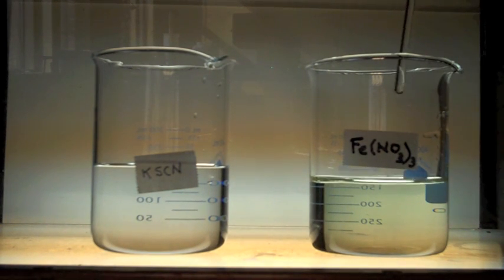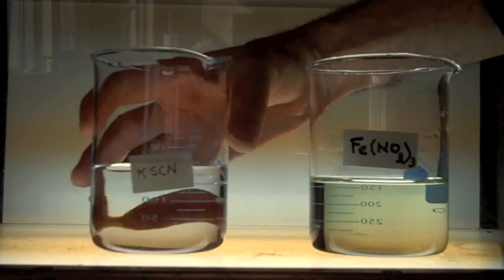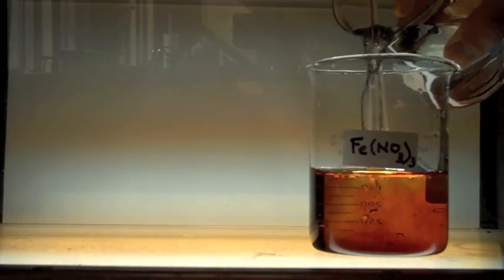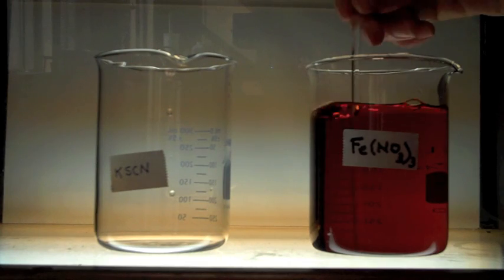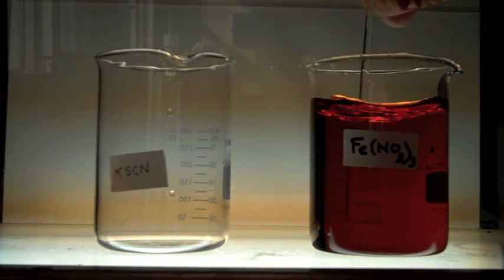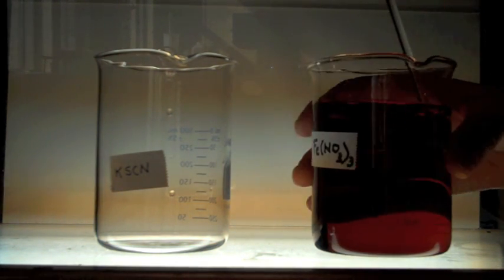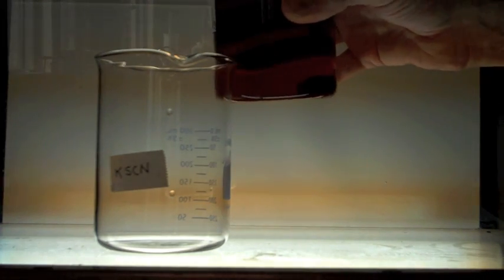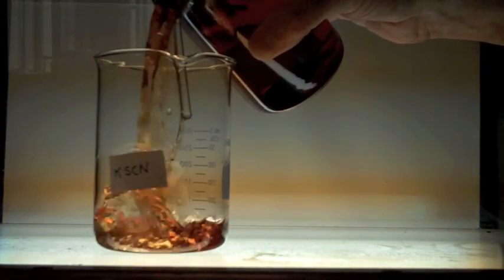Let's mix these two solutions together. And we see we get that rich red iron thiocyanate complex. Let me divide this in two so we have a reference to observe.